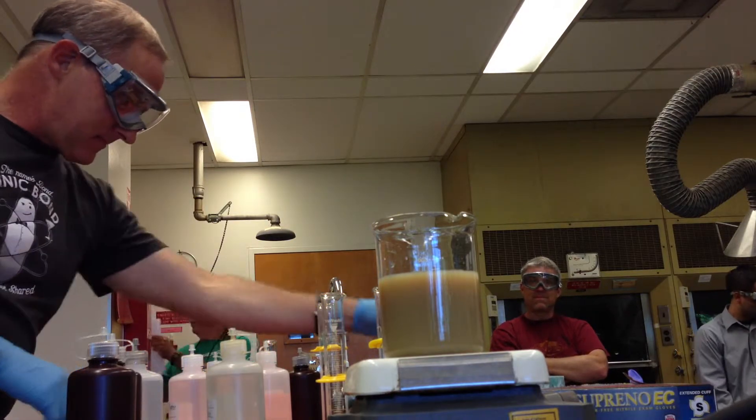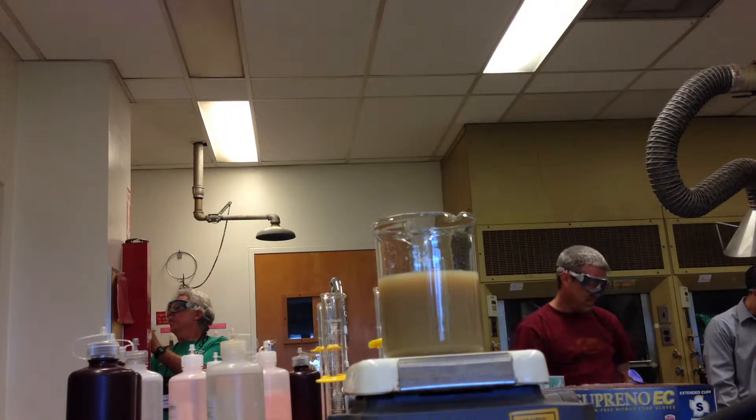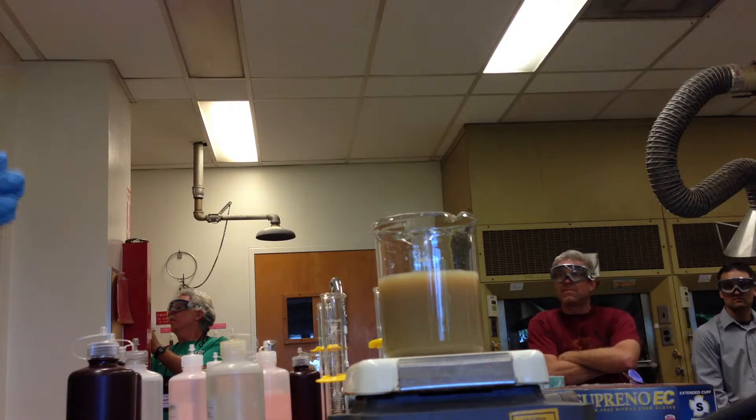Brown. If you've ever done the experiment where you silver the inside of a flask or a mirror, that's what you see.